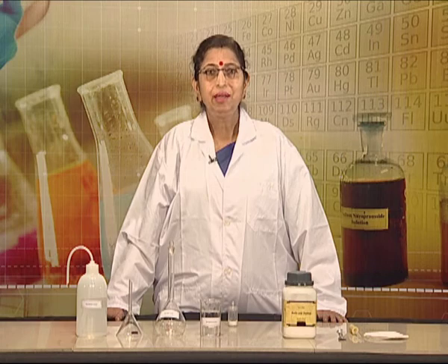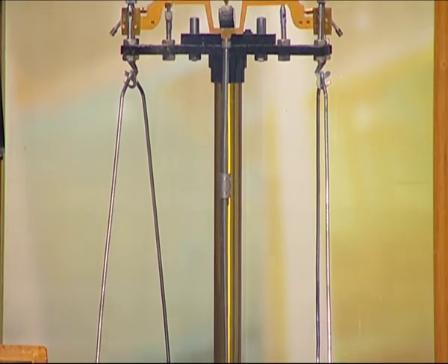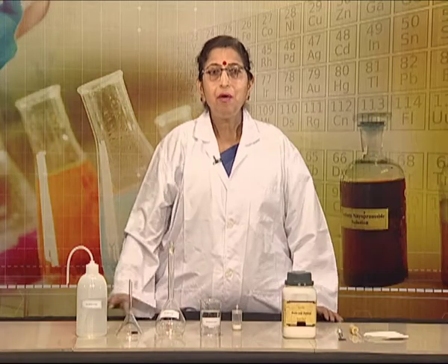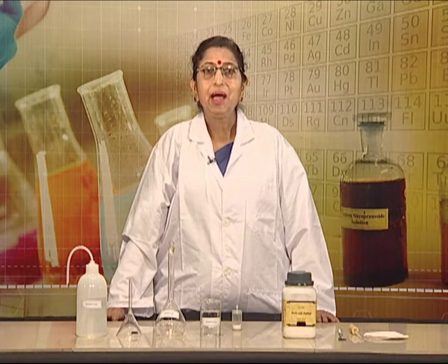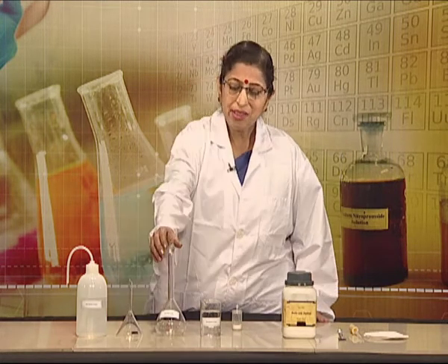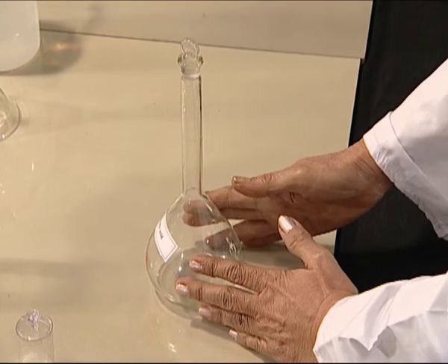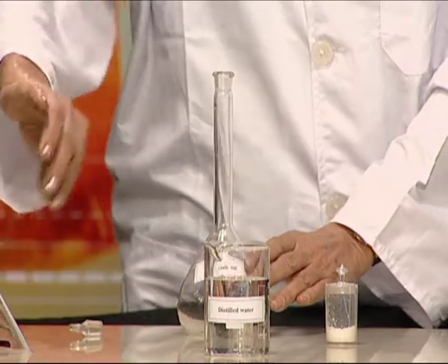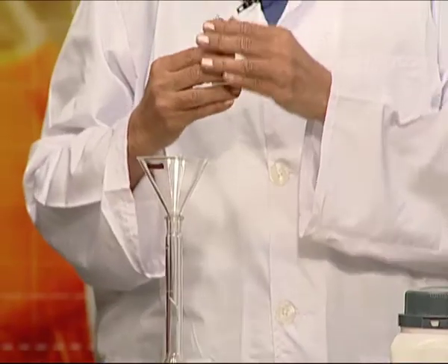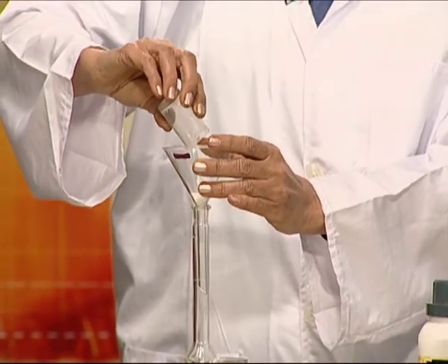Viewers, you have already learnt weighing of a substance using a chemical balance. Here we have already weighed 3.150 gram of oxalic acid in a weighing bottle. Now we are moving to the second step of the experiment, that is preparation of standard solution of oxalic acid. For this we take a clean and dry volumetric flask having the capacity of 250 centimeter cube. We put a funnel on it and transfer oxalic acid into the measuring flask through the funnel.